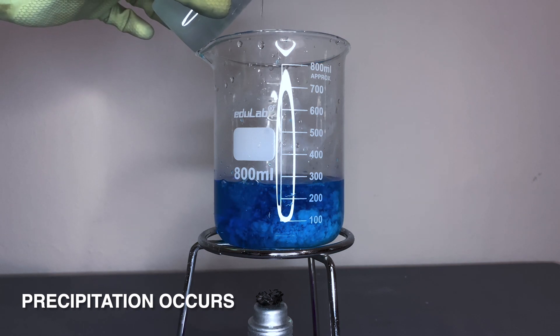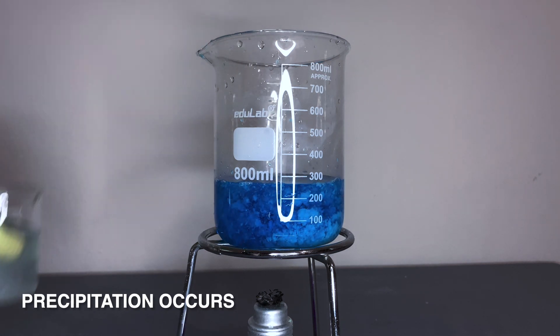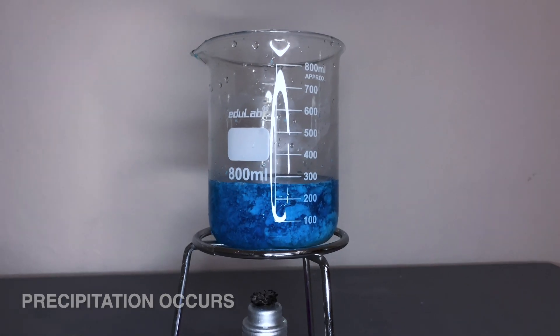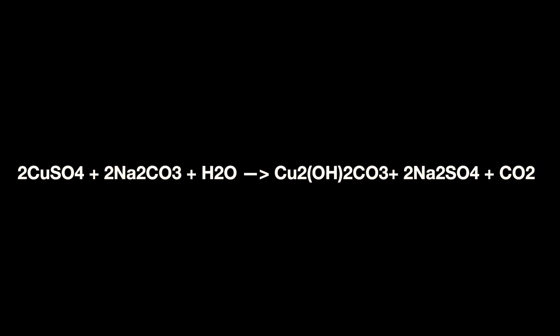Now, you can see precipitation of copper carbonate. This is the reaction that takes place. You can see the carbon dioxide and copper carbonate products.